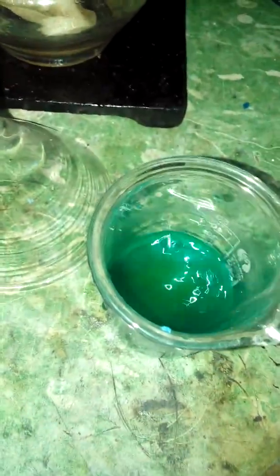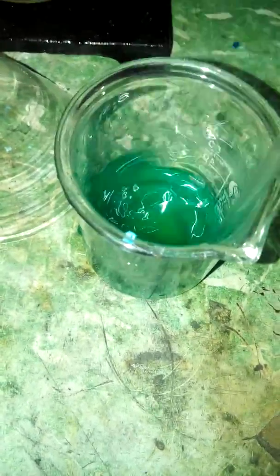We're gonna mix it and add a bit more salt — it doesn't hurt. You'll see it will turn into a really pale green color. At first it was a really blue color, similar to copper sulfate, and now it's changed to this pale green color. There are still some undissolved salt particles in it.